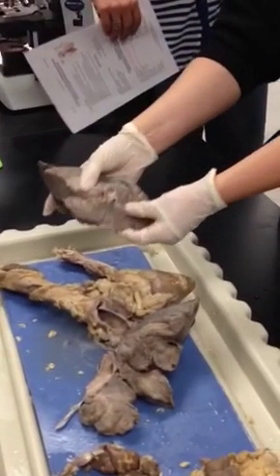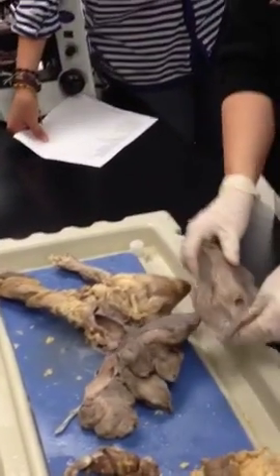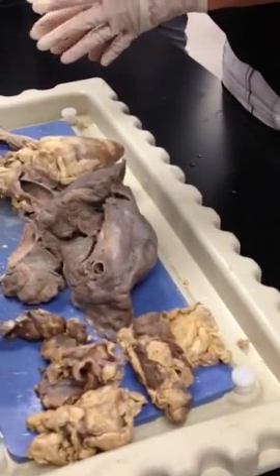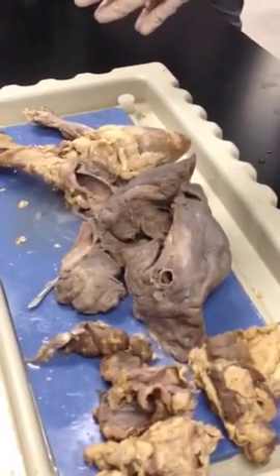I think that's all the structures, we went through them all. It's not too bad. The lung really isn't that bad. The biggest thing is not getting the pulmonary vein and artery mixed up. The primary bronchi sticks out like crazy. Make sure you can count the lobes.